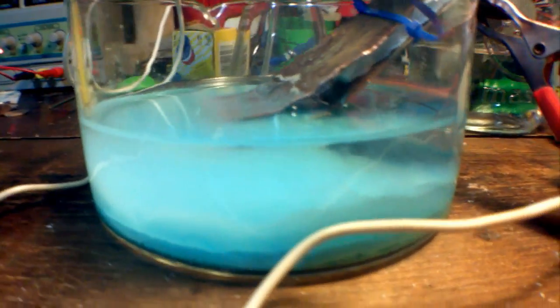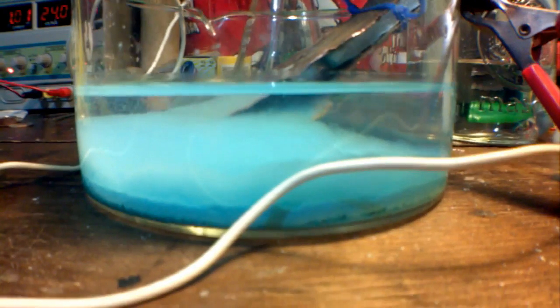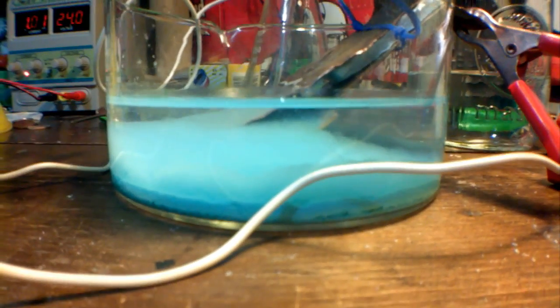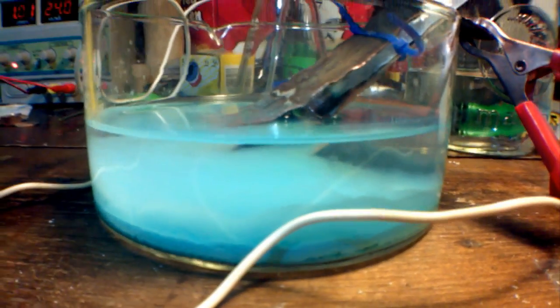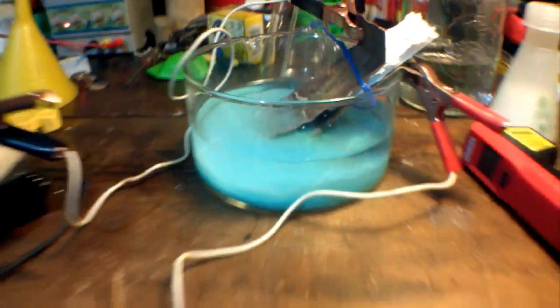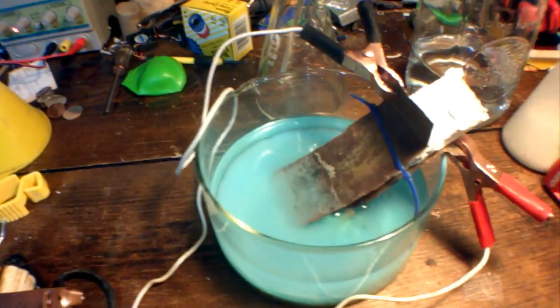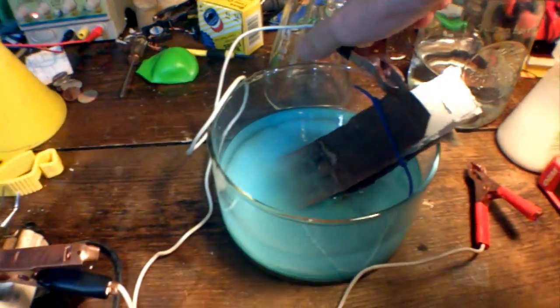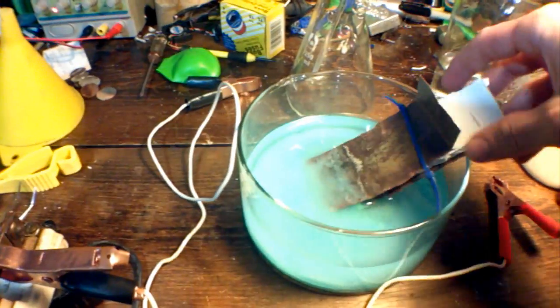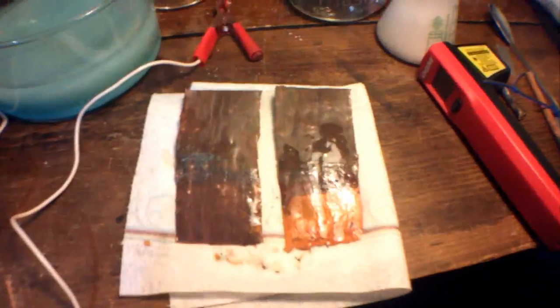So now it is finished. As you can kind of see, there's a little pile of the copper hydroxide building up inside of there. Now let's take a look at the electrode and anode—cathode and anode.